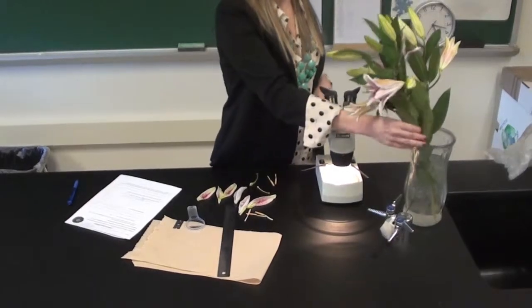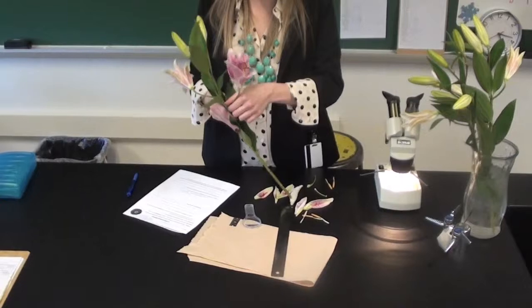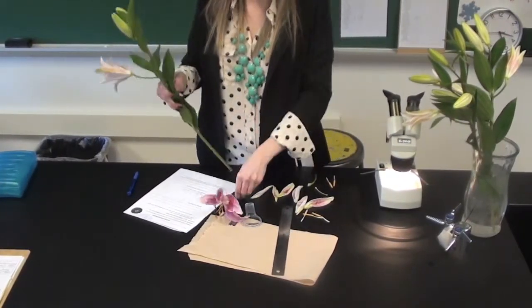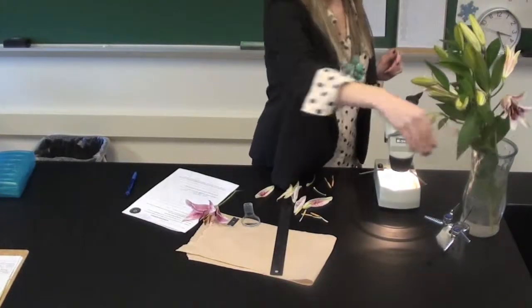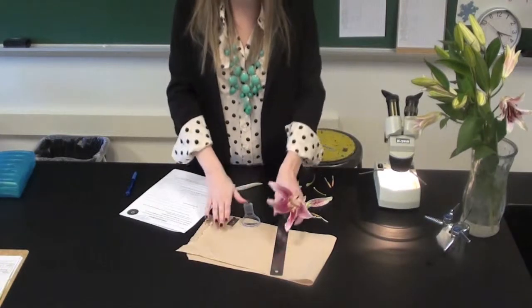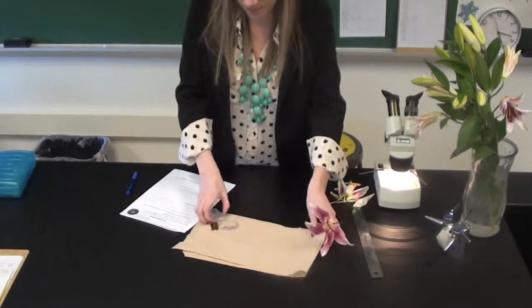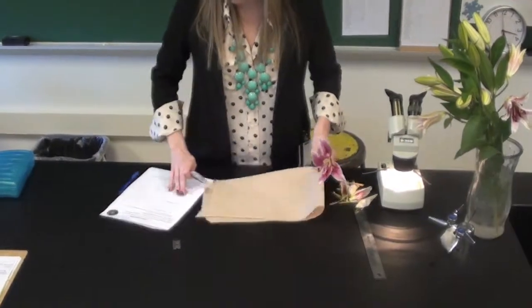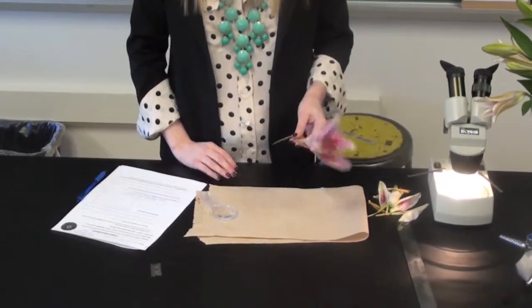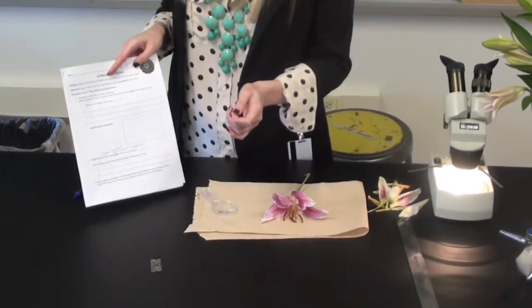Alright, so you're going to come over to the vase and get a flower. And then all you need is just the stem up. So break it off. And then, like I said, we're going to work from the outside of the flower in. So put the paper towel down on your area so that you don't make a mess on the table. And you're going to make your first observations of your flower, and you will be putting these observations on the lines next to the bullet points.